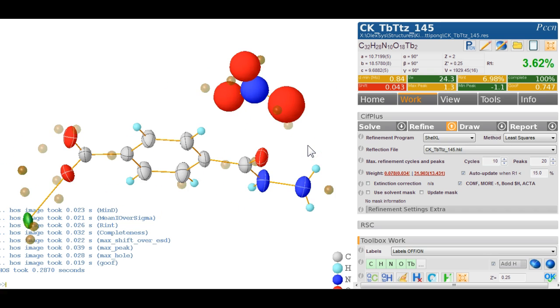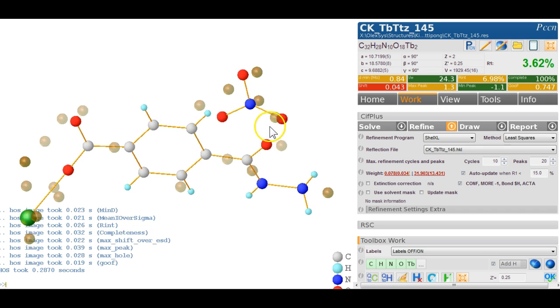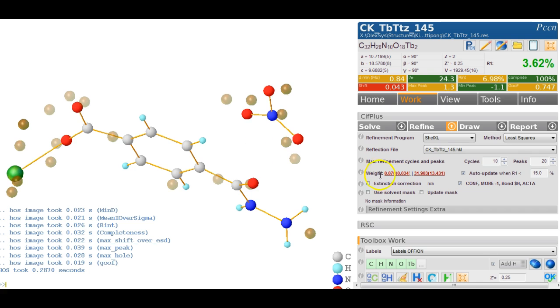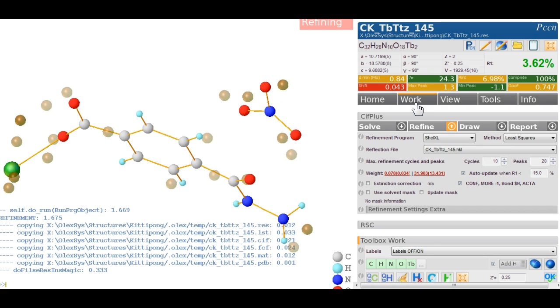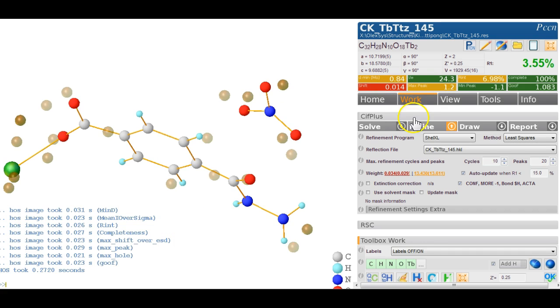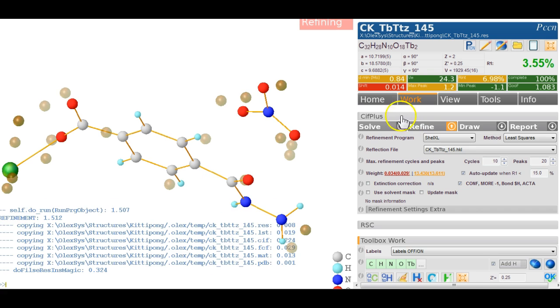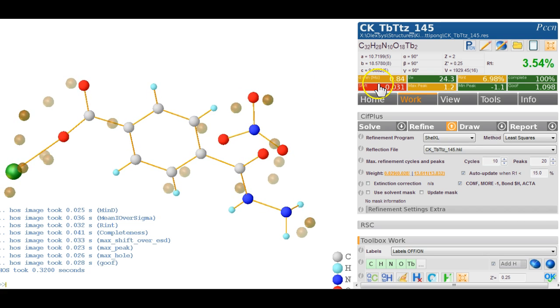If you go fuse, we are back to the asymmetric unit. Go pers to just see how the geometry really looks, and that looks all fairly good, so I don't think we've got much of a problem here. We hit refine a few times and see what happens, or see whether it settles, and it settles slowly, but it does settle, which is good news. And it's there what's moving.